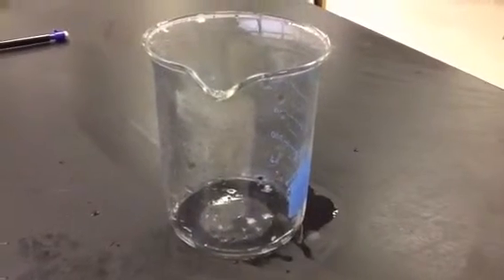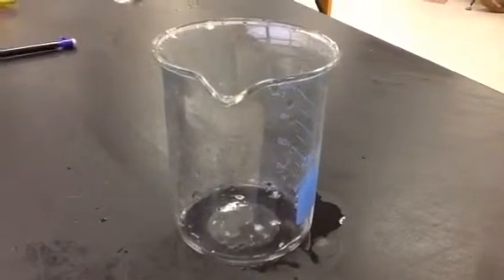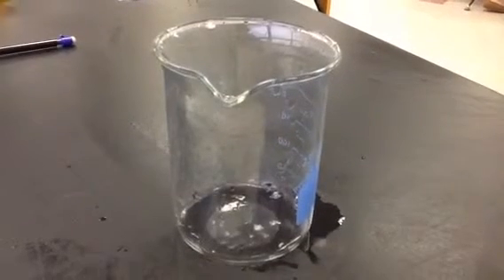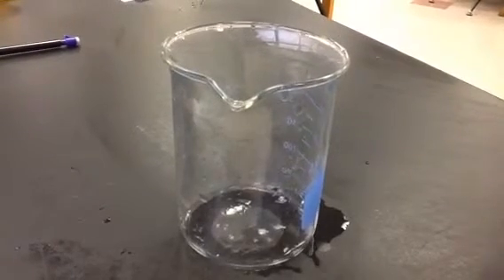In this lab, you will aim to draw conclusions that state the relationship between the amount of solvent and solubility. You will do this by adding water along with the kosher salt in order to test the solubility of the water. The lab will show that there is a direct relationship between the two. You will see that as the amount of solvent increases, the more salt the water can dissolve.